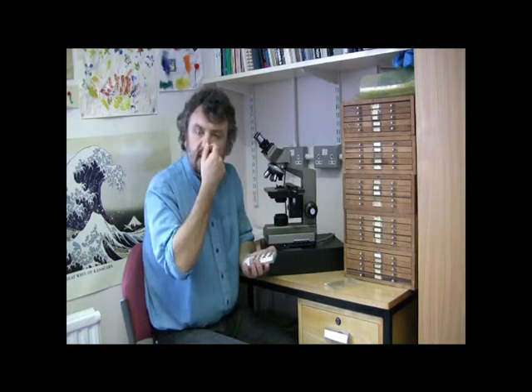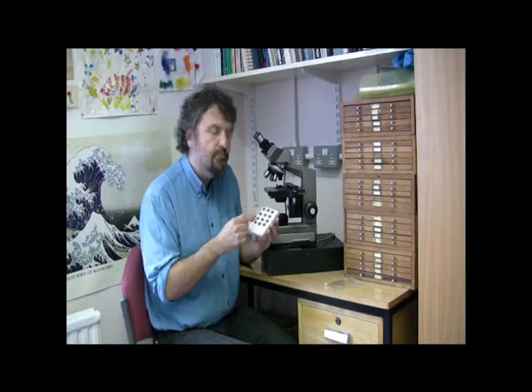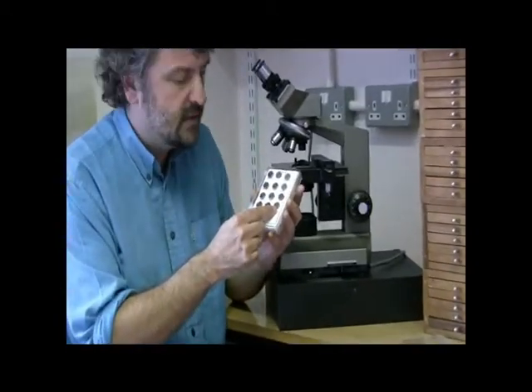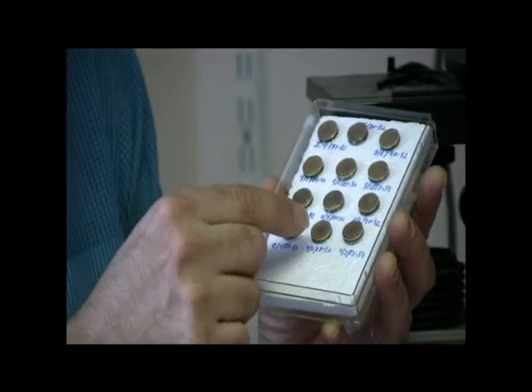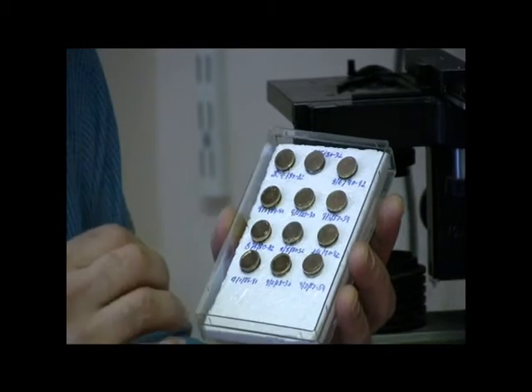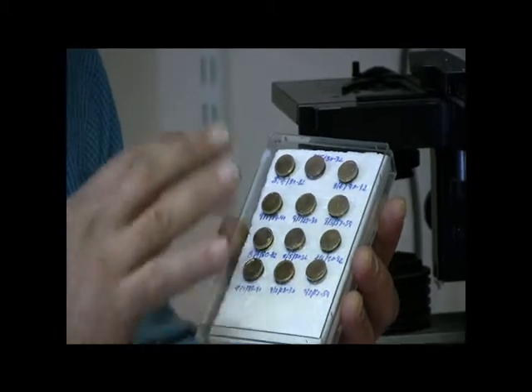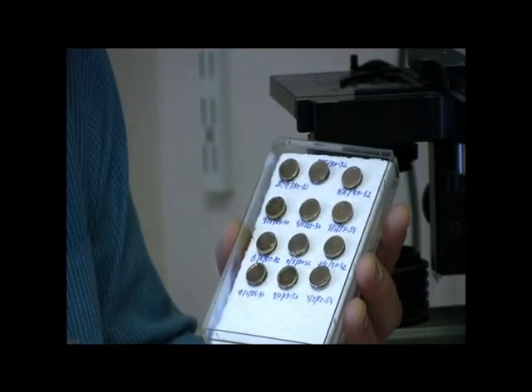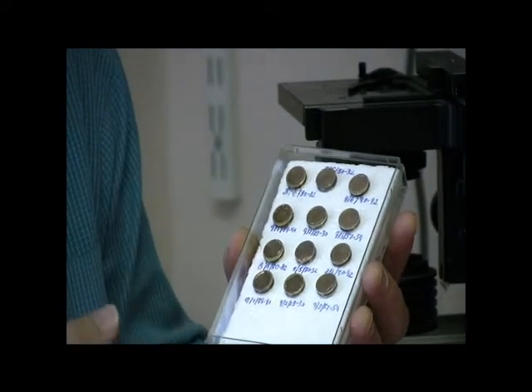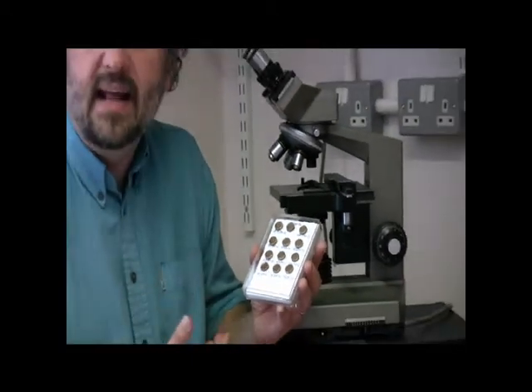There's a slightly different technique in processing the sediment for a scanning electron microscope. You need to mount the material on these little SEM stubs. The sediment is pipetted onto the stub with the radiolaria in the sediment. Usually you put a little bit of gum or a sticky film on the stubs first, then the sediment goes on. For a scanning electron microscope, you need to coat it so that you can actually view the fossils in an SEM.